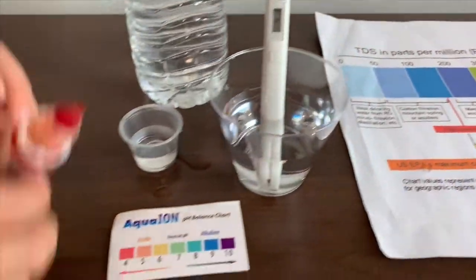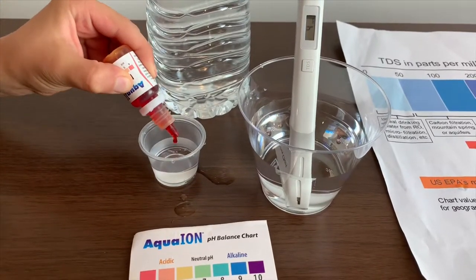Now, let's test the pH level. I'm going to do two drops.